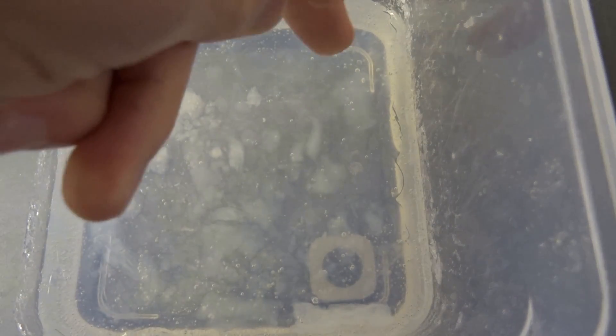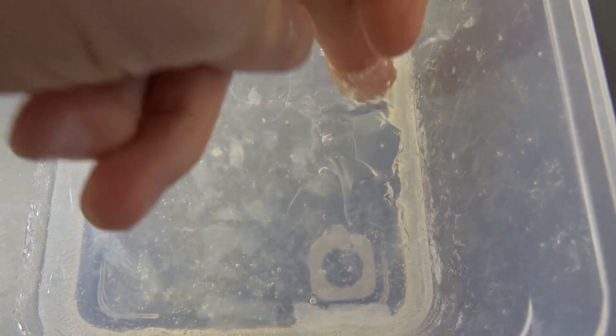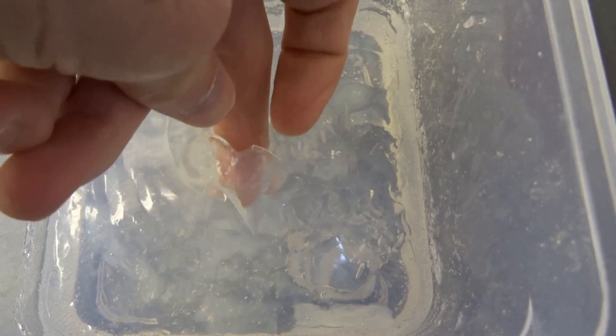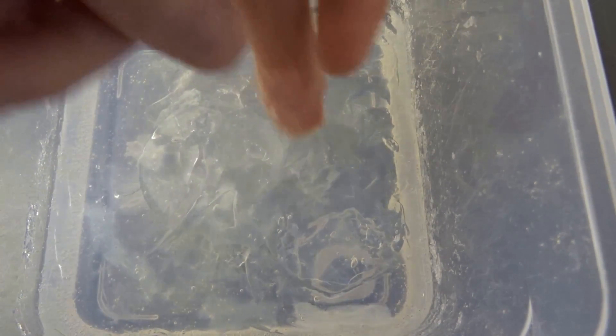Finally, here I have my waste container, which actually formed a gel. I did not intend this, and here I just poured in all my crap, and finally it formed a gel.